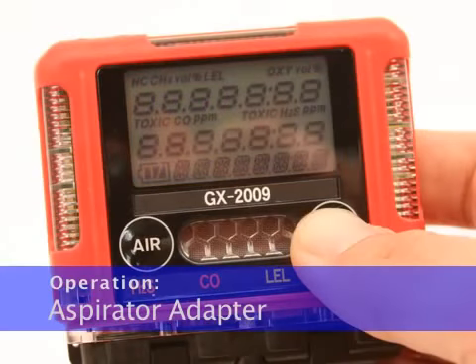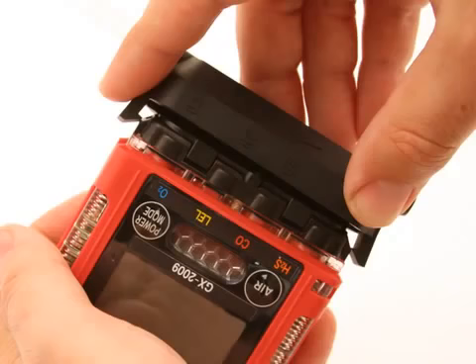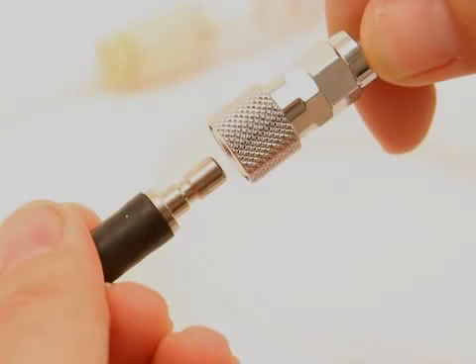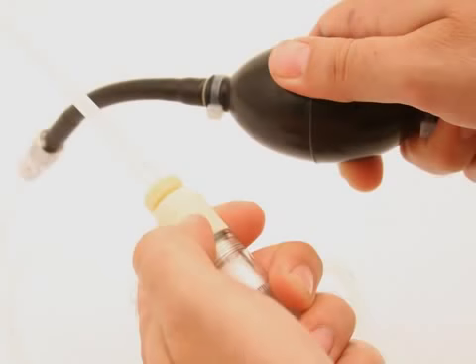Turn on the GX2009. Attach the sample adapter plate to the sensor side of the instrument. Screw the probe onto the threaded end of the 10-foot hose. Attach the 10-foot hose and probe to the aspirator bulb. Insert the end of the probe into the area to be sampled. Squeeze and release the aspirator bulb 15 times.